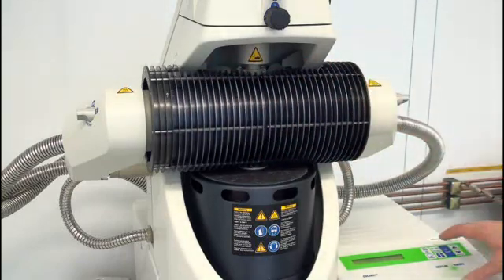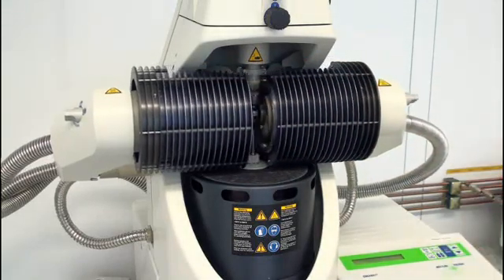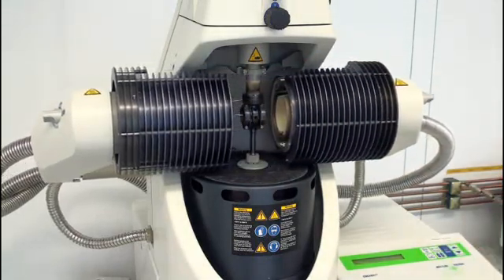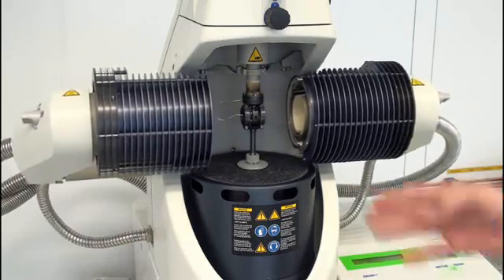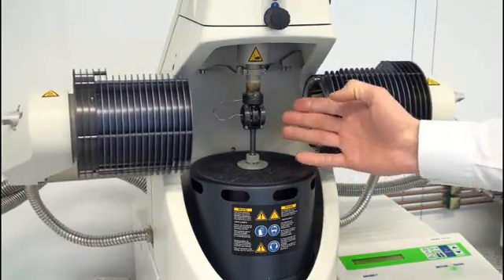This is the furnace and when we open it, you see the clamping assembly.